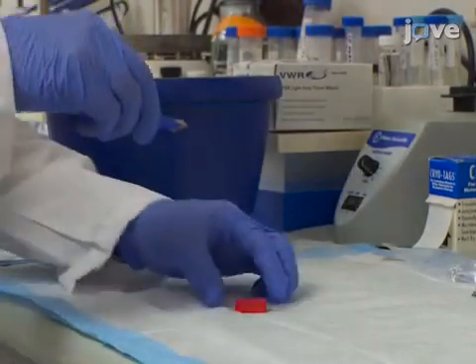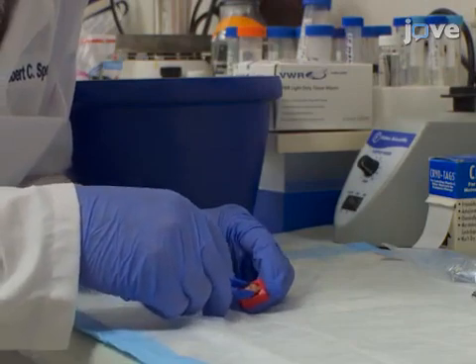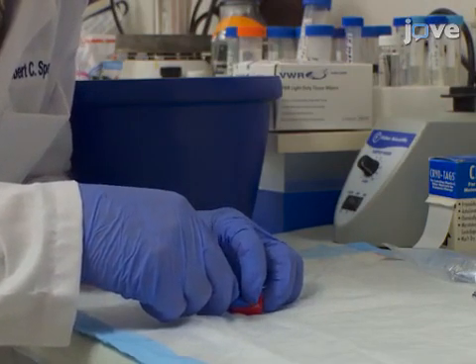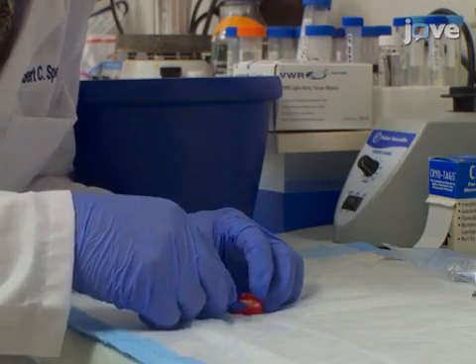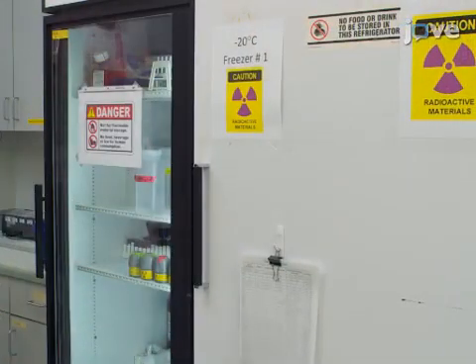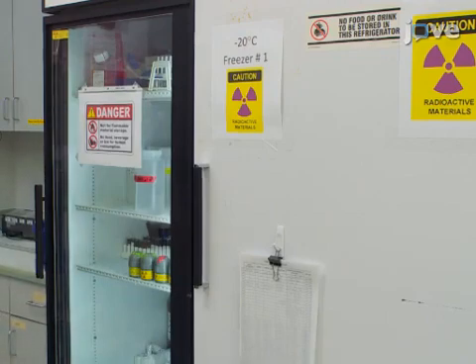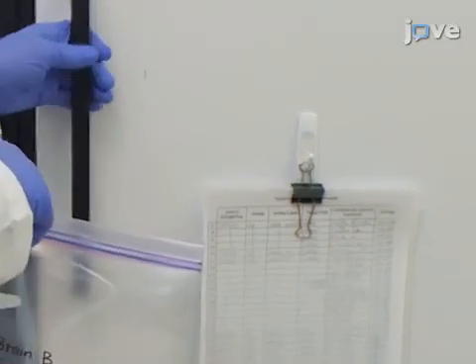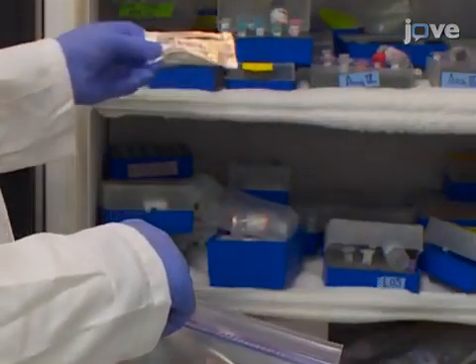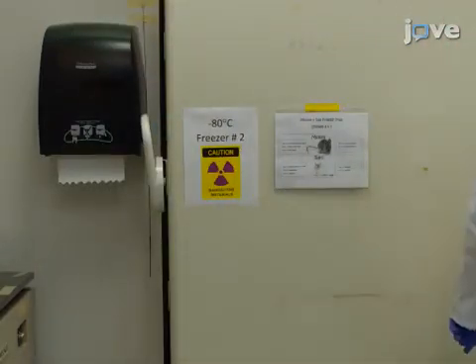Immediately after harvesting, place the brain tissues in brain molds that simulate the inside of the skull and wrap the molds in aluminum foil for minus 20 degrees Celsius storage. After 30 minutes, transfer the tissues into a sealable freezer storage bag and store the bag at minus 80 degrees Celsius.